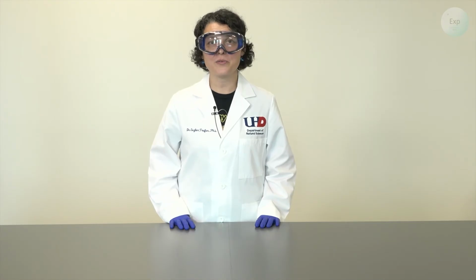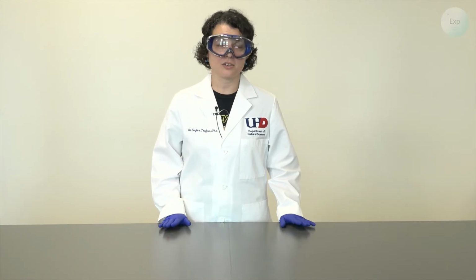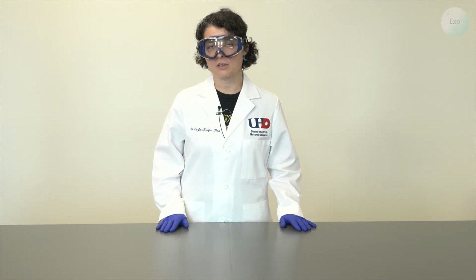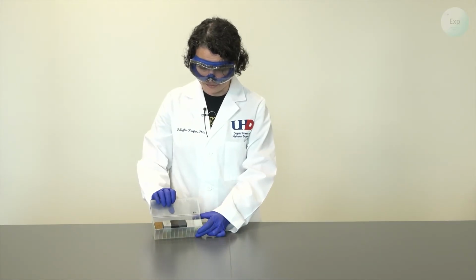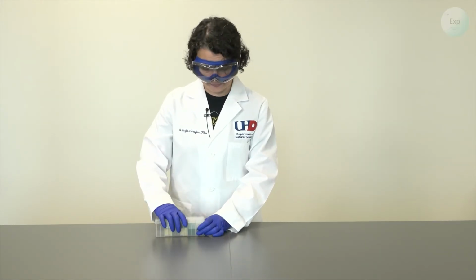My name is Dr. Esther Trufan, and in this video, I am going to demonstrate how to collect the measurements you need to determine the density of a regular solid. And what we mean by regular solid is a regular shape, either rectangular or cube. And I have an assortment of different materials right here. All of them are cube shaped.